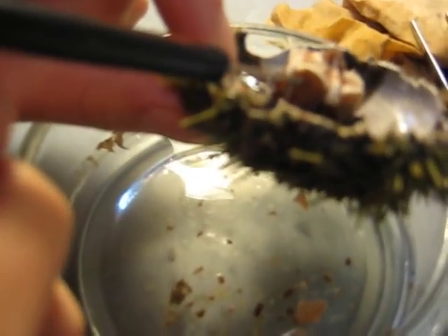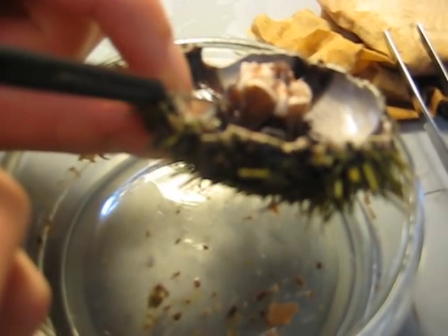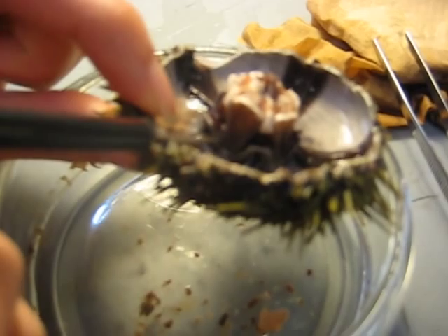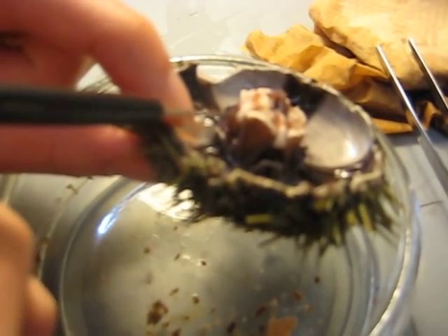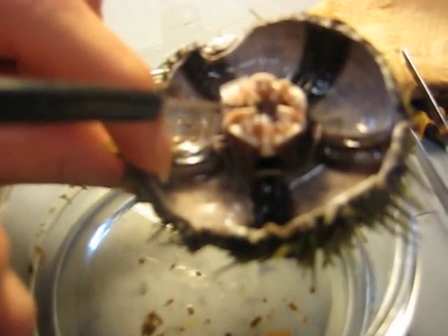These parts right here are the muscles. And then these — this little lighter area, I don't know if you'll be able to tell the difference, but it's attached here — those are the radial canals. They're attached to this right here, which is the hard part of the tooth. Obviously following up, you get to the softer part of the tooth.